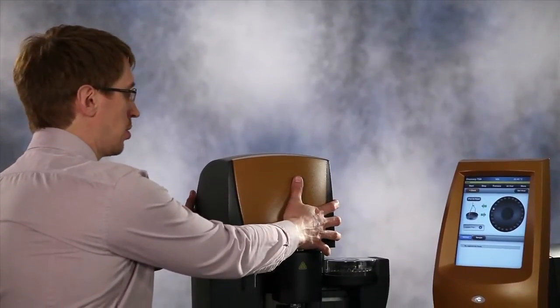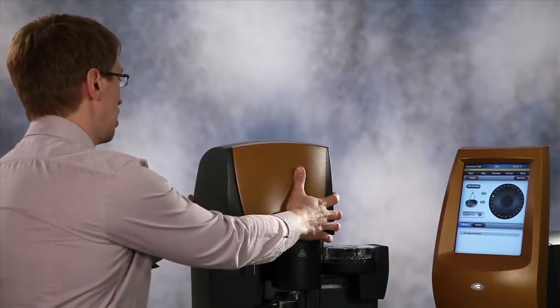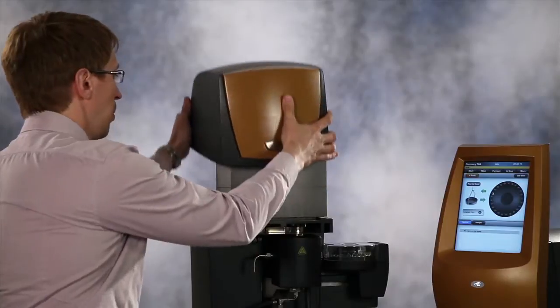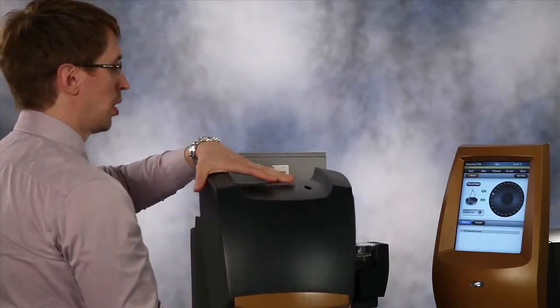In order to gain access to the balance housing, we need to remove the balance cover. We can do it by removing two screws in the back.